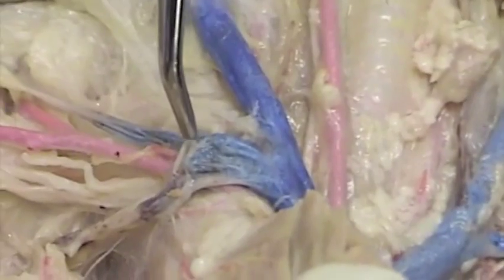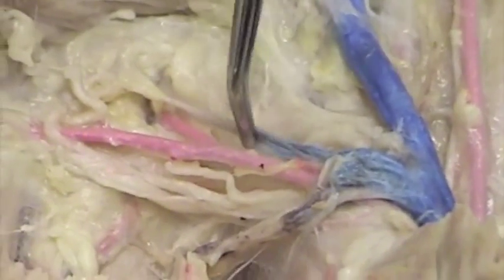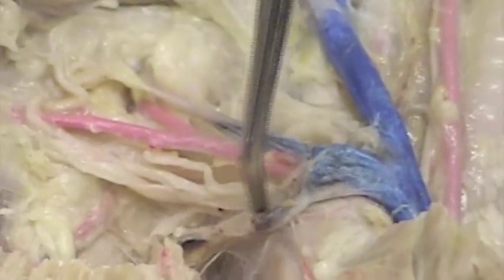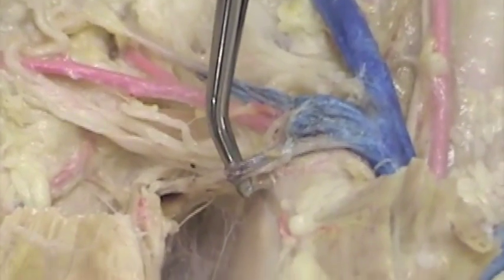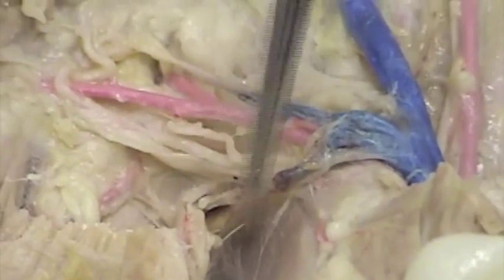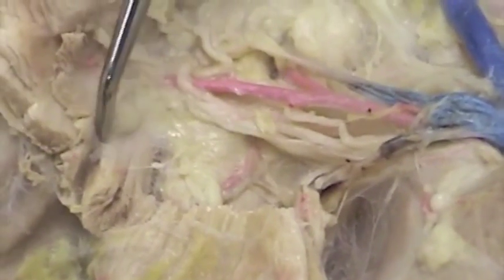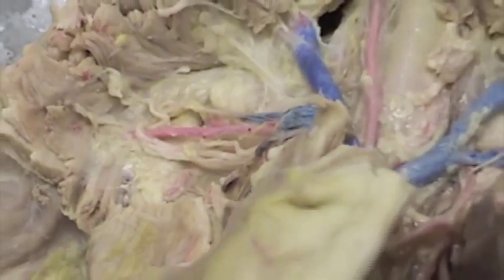On this particular side of the cat, you can see the right subclavian vein dividing. Here we have a section going here, and here we have a section going on into the arm. The section going into the arm, even though it's not very apparent here, would be the axillary. It looks like it didn't get much latex in this cat. Axillary in the underarm area, and then on into the arm, it would be the brachial vein. And that finishes the veins for the thoracic cavity.